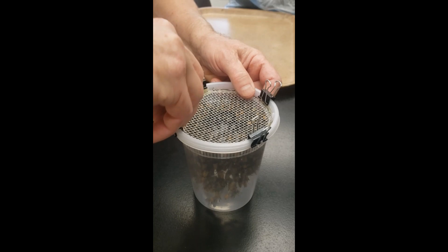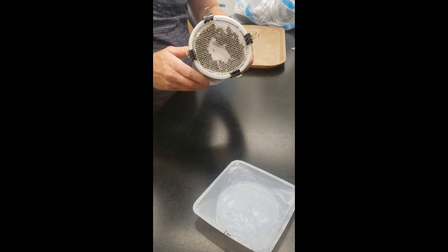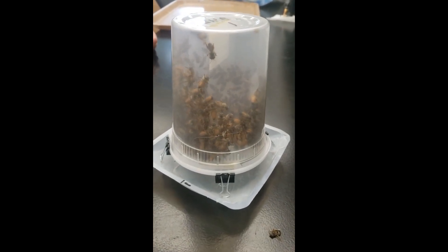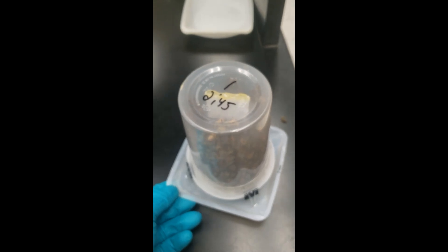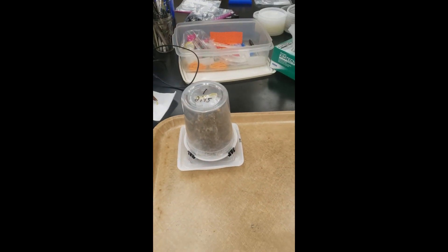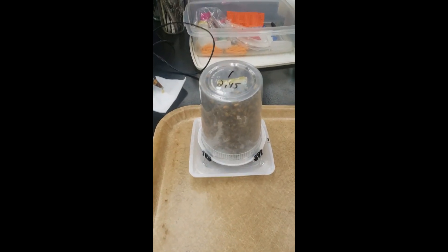We create a method to hold it up off the tray. Now that test container gets inverted and put onto the tray like this. Match up the corners of the tray with the clips like this — it holds it in securely. Make sure the colony number on the top matches the number on the lid. Once you have your setup, keep it in a stable condition out of the direct sun.